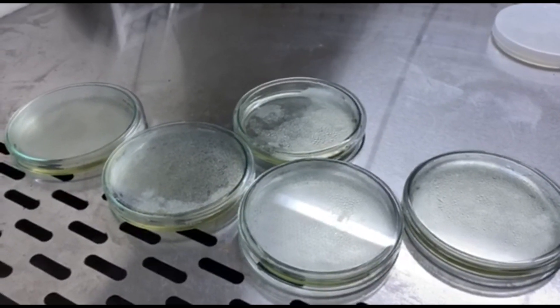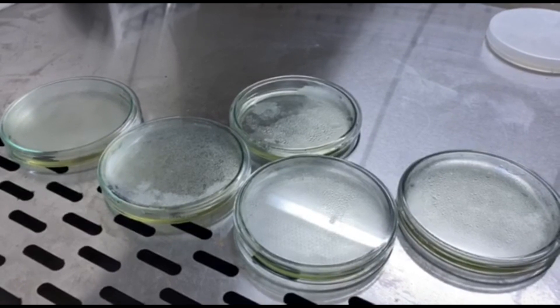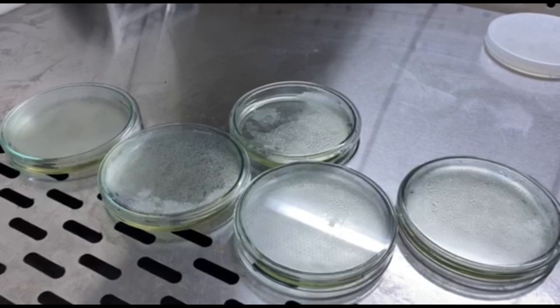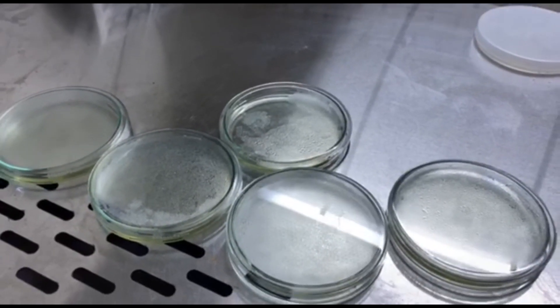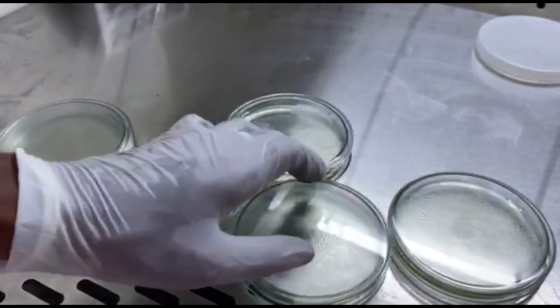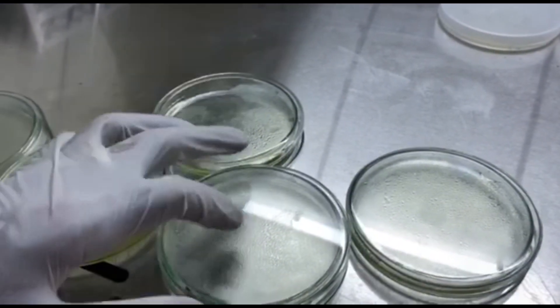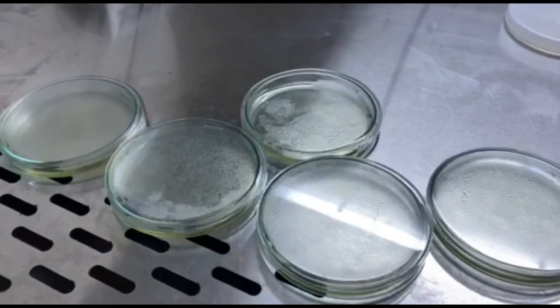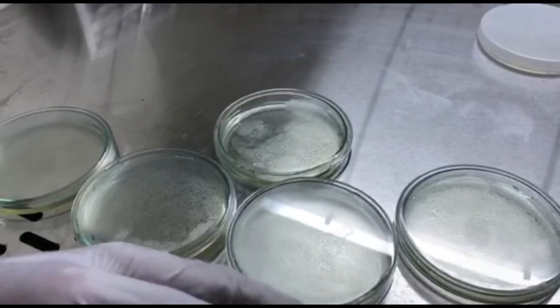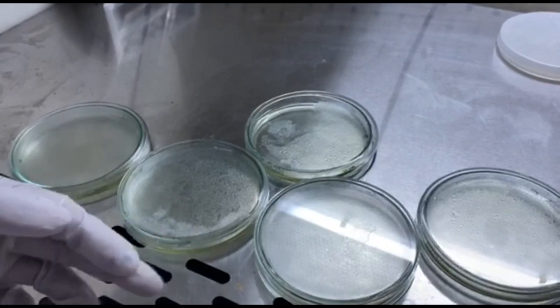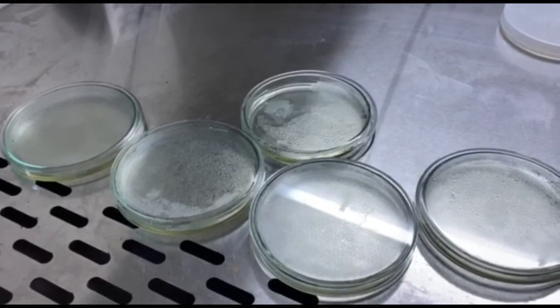After the plates have been poured, we have to wait for some time for the nutrient agar to settle down, to get solidified. And only after that we can add the second layer of the blood agar, the blood media that is. To check whether your media has been solidified, you can tap on top. If you could see that while tapping the media is not moving anymore - it's been now 15 to 20 minutes that we have waited in the laminar flow. And now you can even nudge the plates a bit. On nudging you can see that a little jelly type consistency can be noticed, but do not nudge too hard because otherwise that might disrupt the media. So this shows that we still have to wait for another 15-20 minutes or more till the media completely solidified.